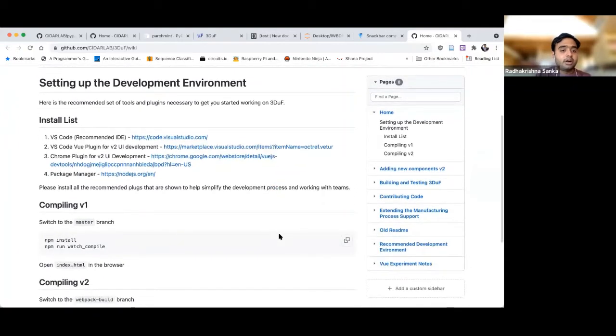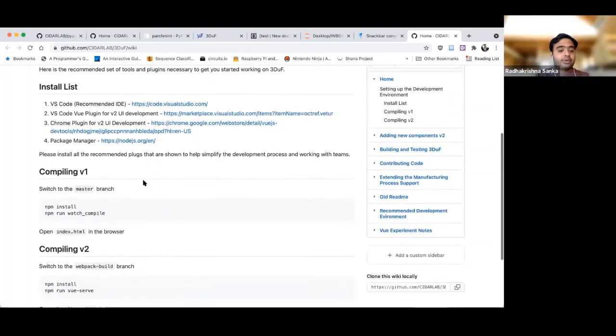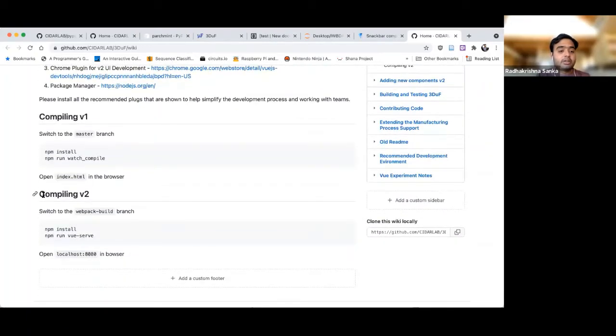And this is essentially all the things we recommend: what your recommended IDE is, what kind of plugins you want to have for development, for Chrome development and everything, and what package manager we want you to install for working on the JavaScript code. And for this particular workshop, we'll be working in compiling version 2, extending and playing around with version 2. Because that's our new, more easy, more open source accessible version, which we want people to mess around with and add more features to in the future.